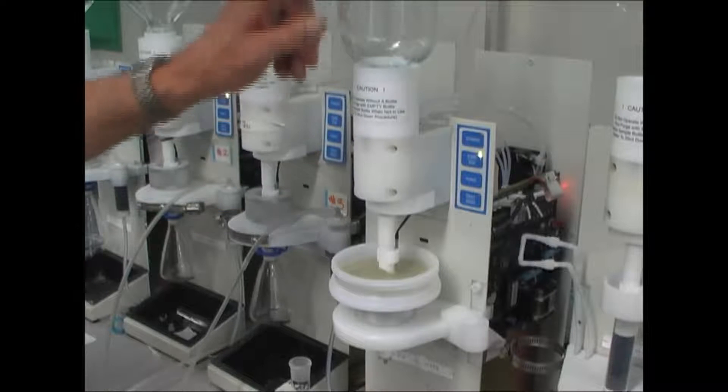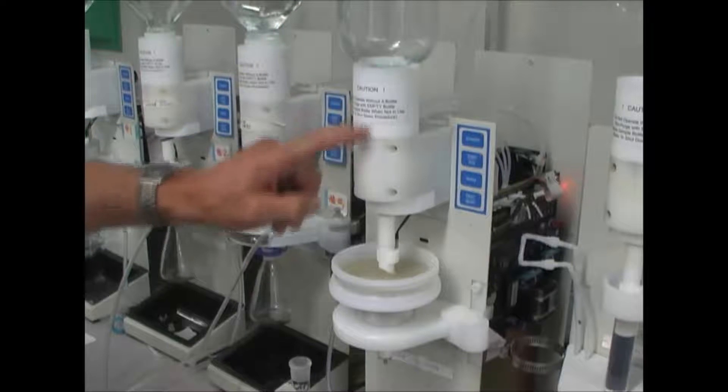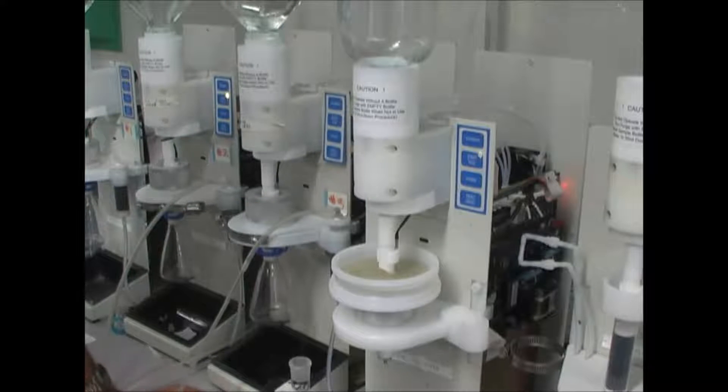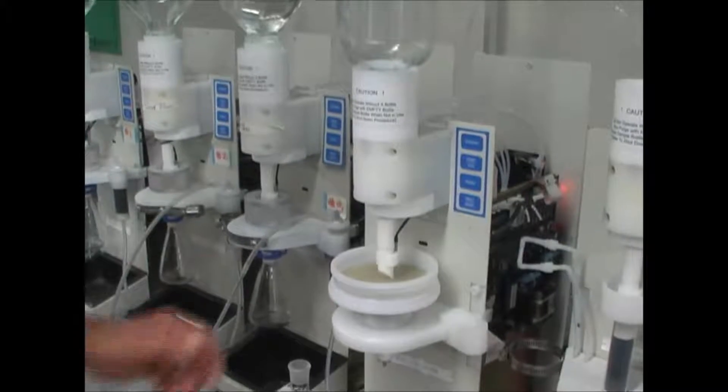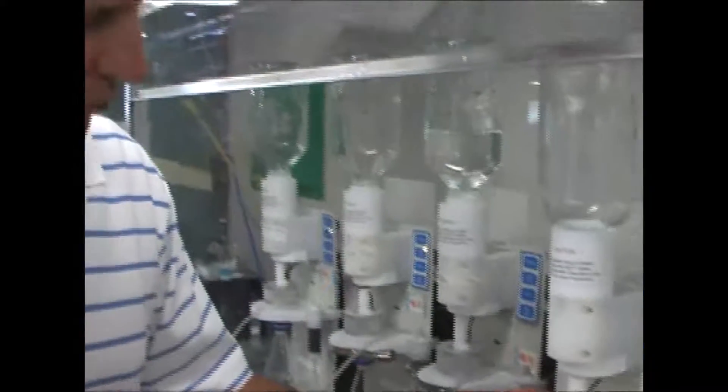That's eleven minutes, the sample is drained from the bottle and is now just coming out of the water in-valve. That's twelve minutes, and the disc is almost dry. The liquid sensors will now pick up and sense that the water sample has finished, and it will advance into the air dry step.